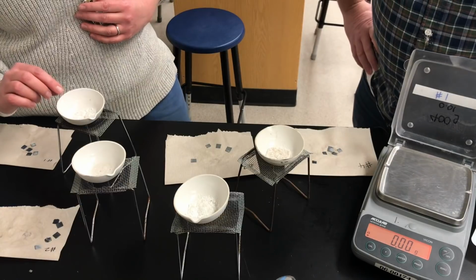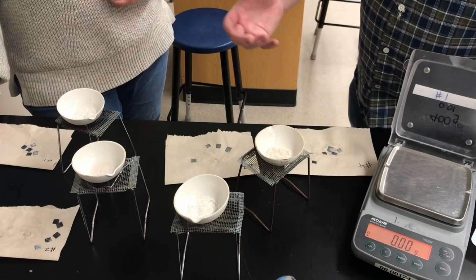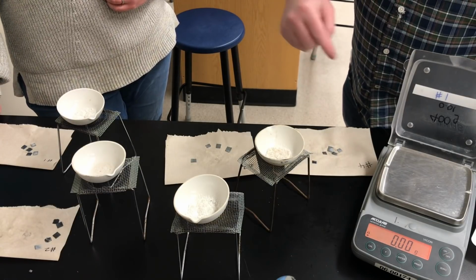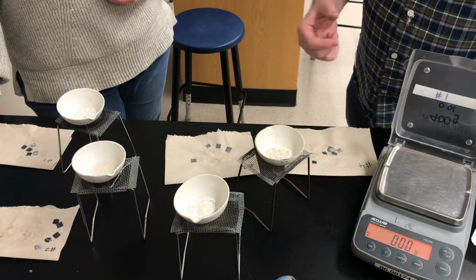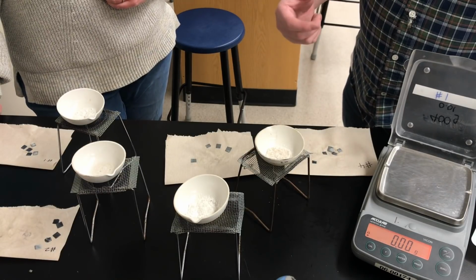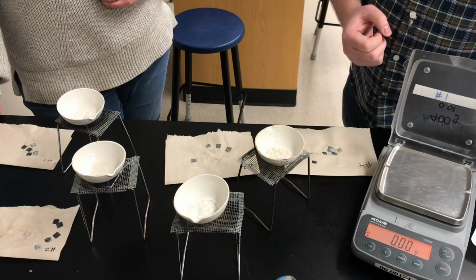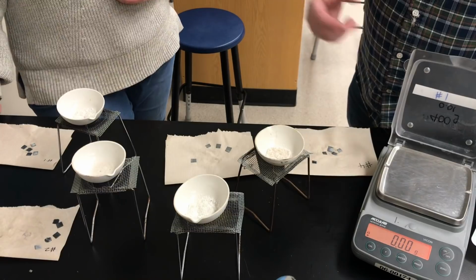Now, if you're a grade 11 chemistry student watching this video, you're able to actually predict, based on the amount of hydrochloric acid that we used, our limiting reagent. You should be able to predict what mass of zinc chloride we should have produced in the experiment. So as you see us record these masses, you're going to have the actual yield of zinc chloride for each of these 4 experiments. You could calculate the theoretical yield doing a stoichiometry calculation, and then the percent yield for each experiment. So let's weigh the first dish.